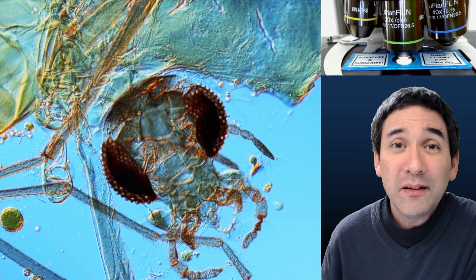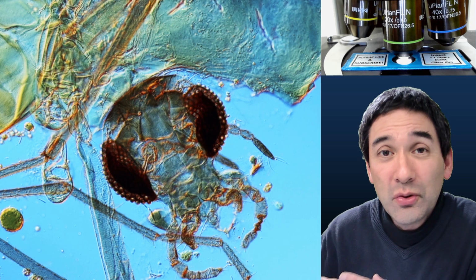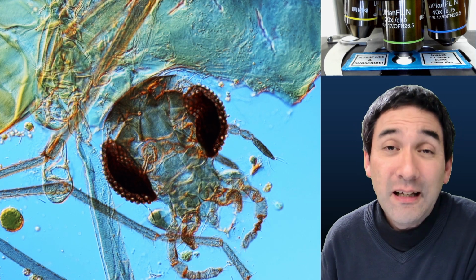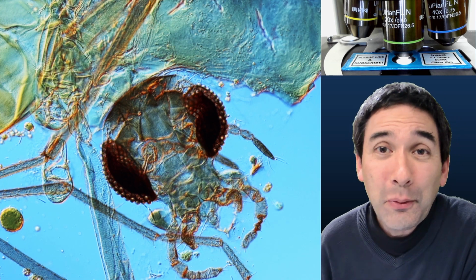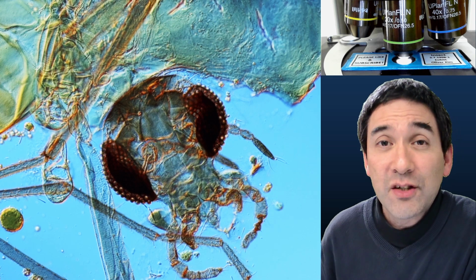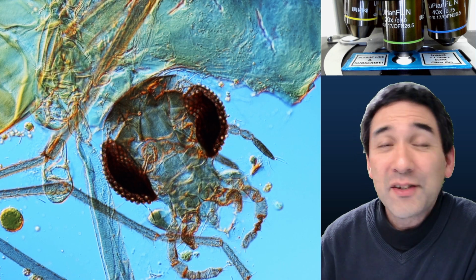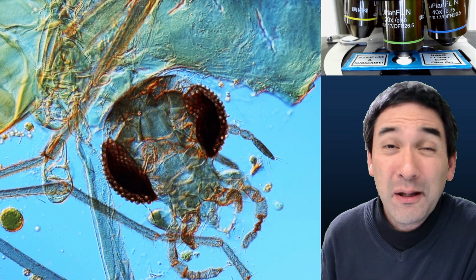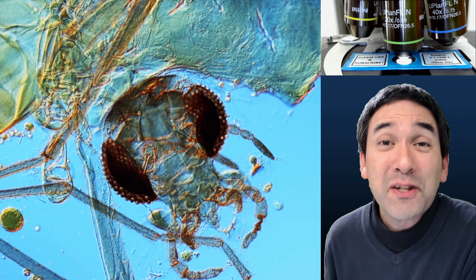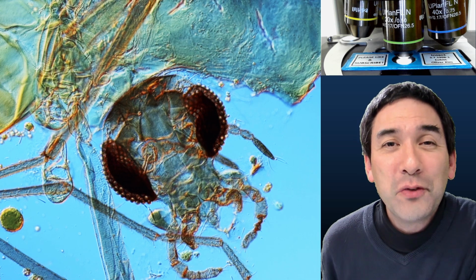So it could be that if the specimen is too moist, it's going to enclose the moisture inside the microscope slide. And then if bacteria start to decompose the specimen, there is of course the possibility also of decomposition gases forming. And then you've got bubbles, and this might lift the cover glass away, and the specimen becomes unstable. And after all, when we prepare specimens, we want to make sure that they are stable for many, many years to come, ideally for the next 100 years.